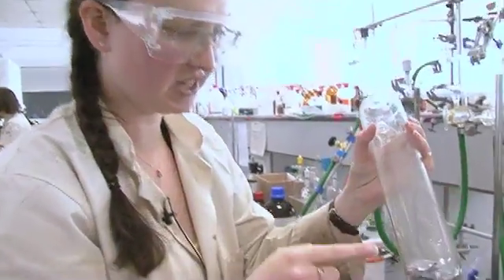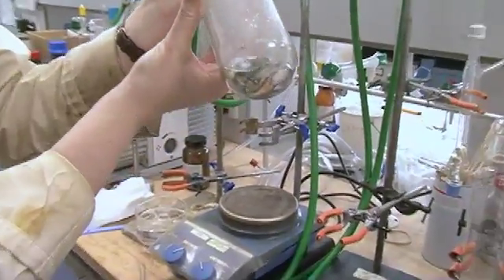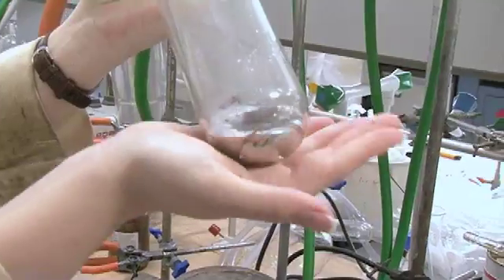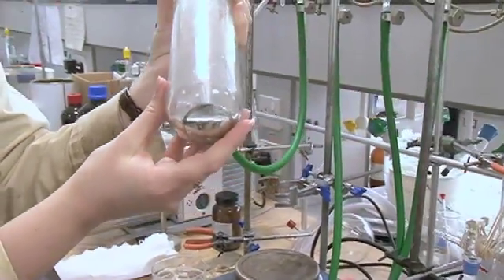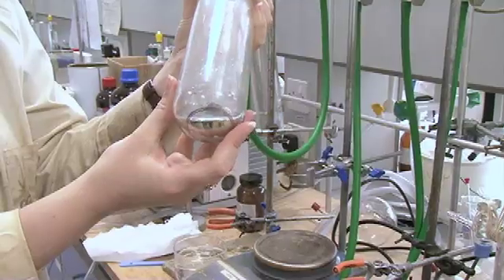It's a sodium-mercury amalgam. You see, there's a little bit of crud on it, unfortunately. That's always the way. But now this is, it's a little bit warm, and we've got sodium dissolved in mercury. I'd say probably about a gram of sodium dissolved in that mercury.